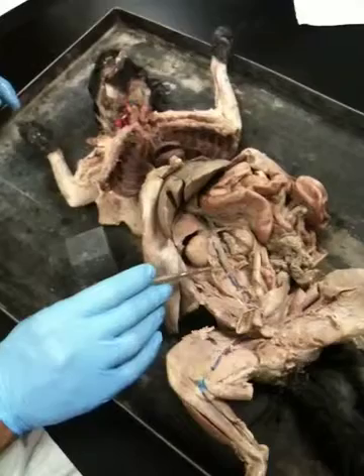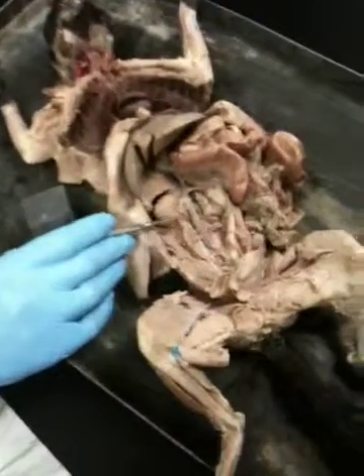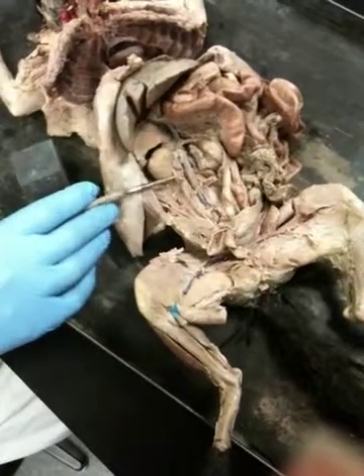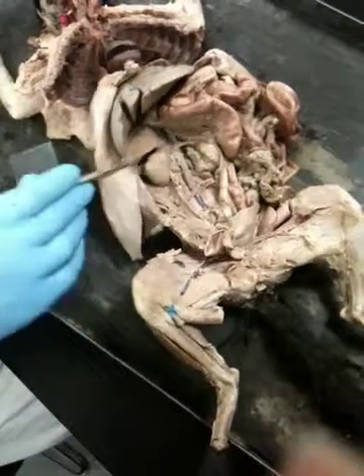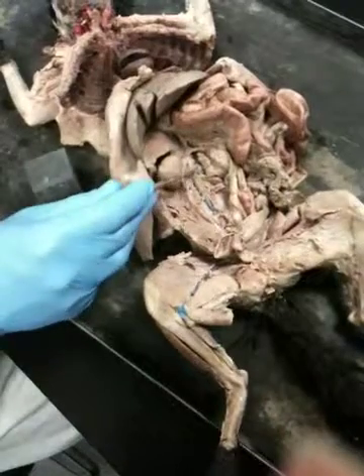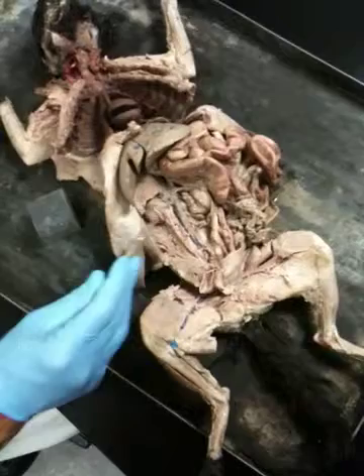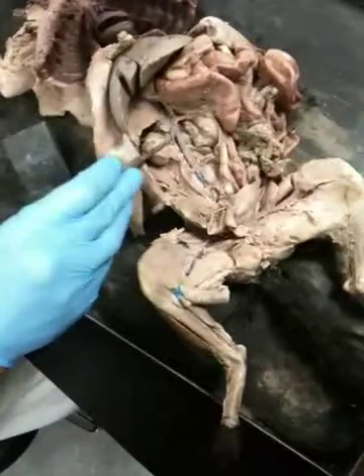Here you could see iliolumbar arteries right there. Okay, here you could see the ovarian or gonadal arteries right there. So whatever the organ is associated with, that's what it is. Here you could see renal vein. Right next to it, you should be able to see renal arteries, but that's what it is. They usually have it side to side. So right there.